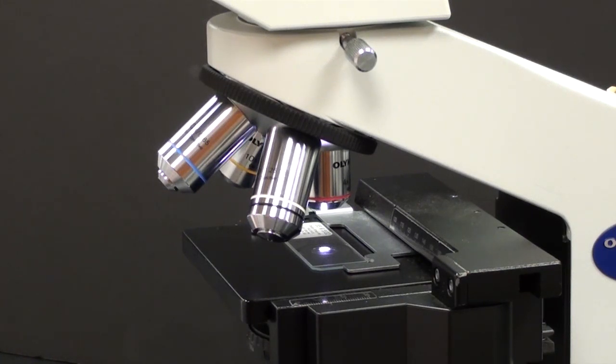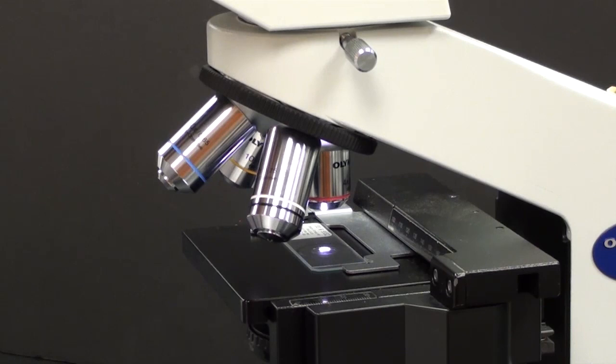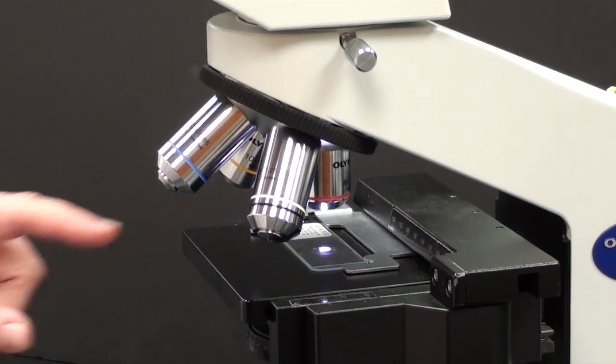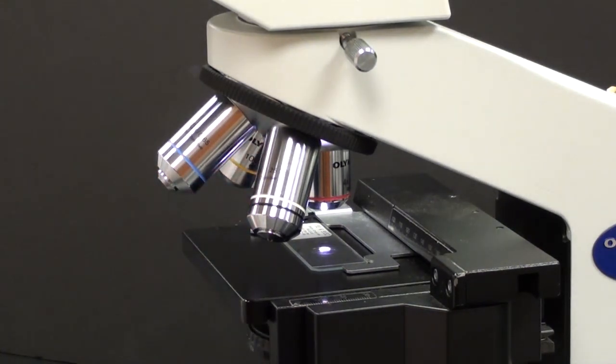This is a crucial moment. This is when you should take the extra 2 or 3 seconds to be sure what you want to see is in the middle of the field of view. So the two secrets for success are: always begin with a scanning lens and always take the time to put what you're interested in in the middle of the field of view.